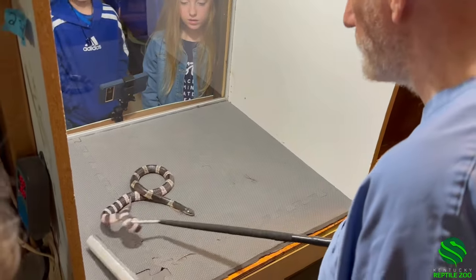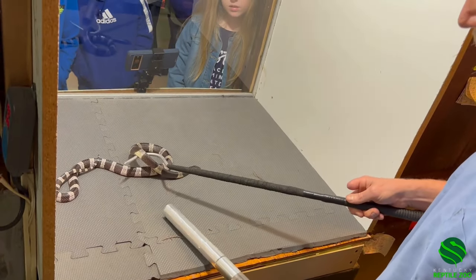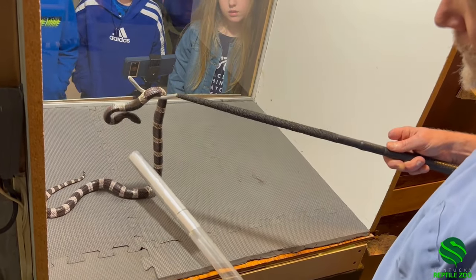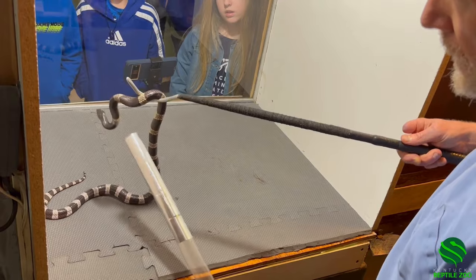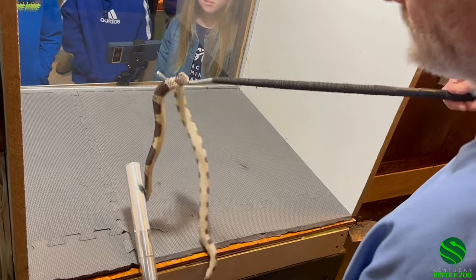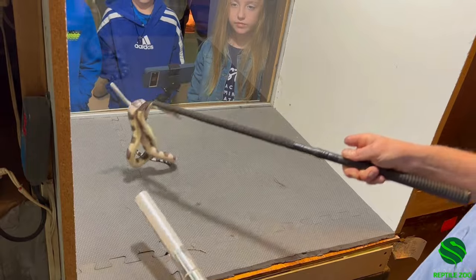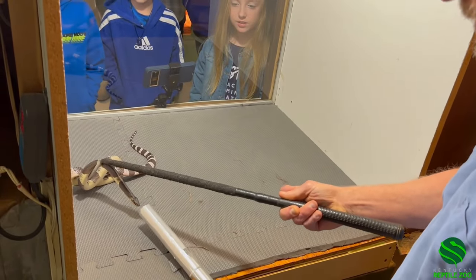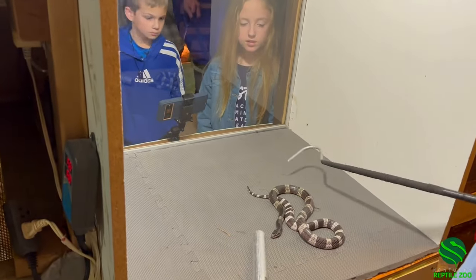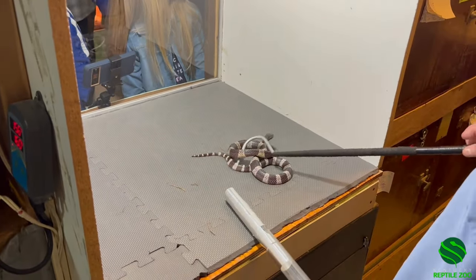Want me to try? No, because then I have to switch hands — it doesn't work. I'm touching it. You rest the tube against this so it's not shaking. Of course then you don't have as much movement from it. It just may not work for you — I've had good luck with it, but that doesn't mean the same thing works for everybody. It's also different when you're taking the snake out.